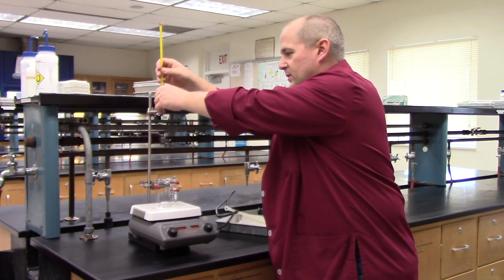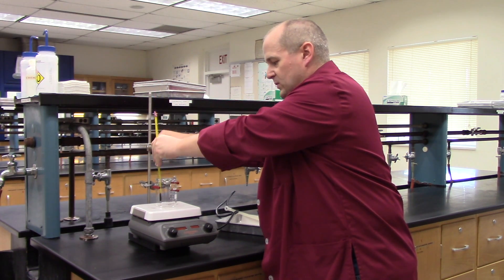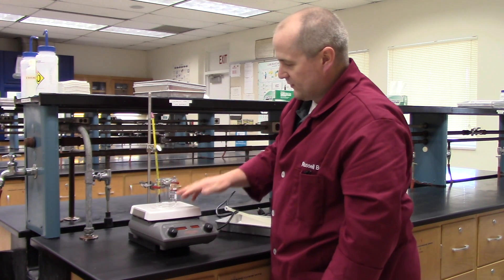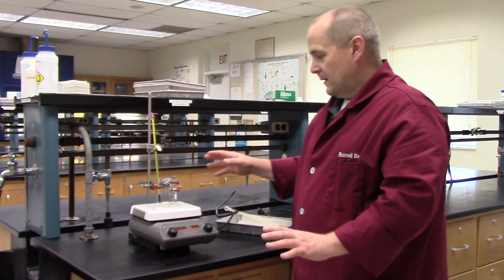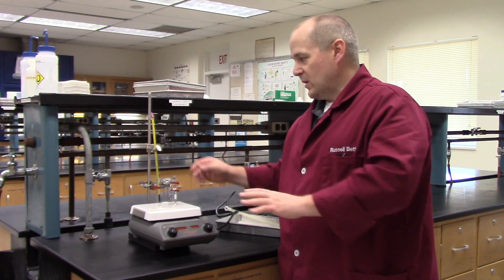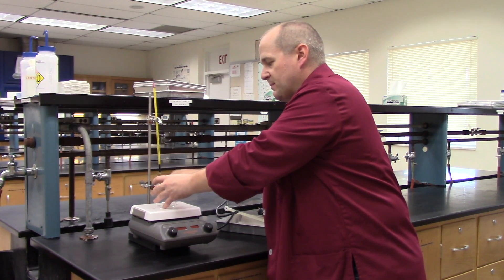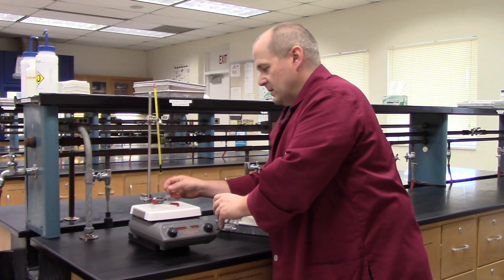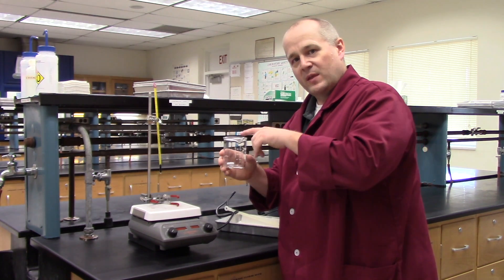Take the thermometer, slide it through the top of the thermometer clamp, and place it off to one side of your beaker. Don't place it in the center because that's where the stirring bar is going to be. Place it off to one side, but do not let the thermometer hit the bottom of the beaker. That's your setup. After you set it up, raise the clamp back up so it's out of your way, then unclamp the beaker and leave everything else the same. Take the beaker to the balance and weigh your Crisco or fat directly into the beaker — do not use a weighing boat.